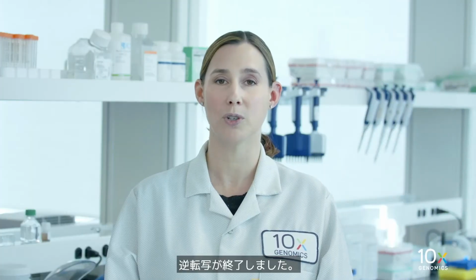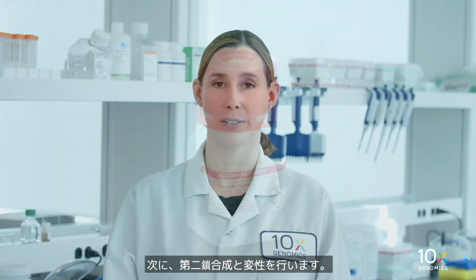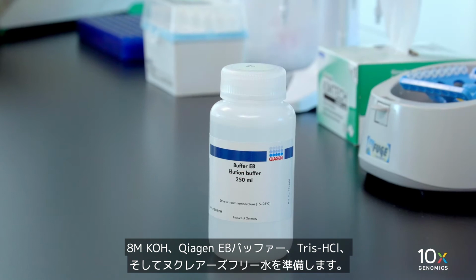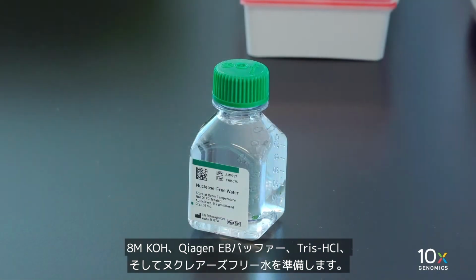We have completed reverse transcription. Now we will perform second strand synthesis and denaturation. We have 8 molar stock KOH, Qiagen buffer EB, tris, and nuclease-free water.